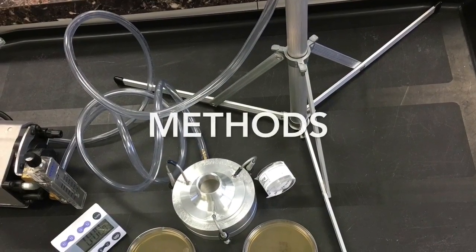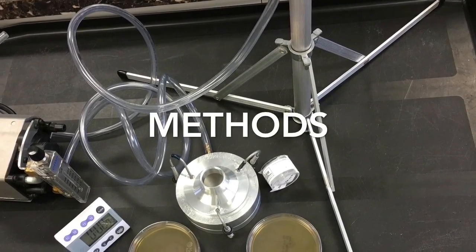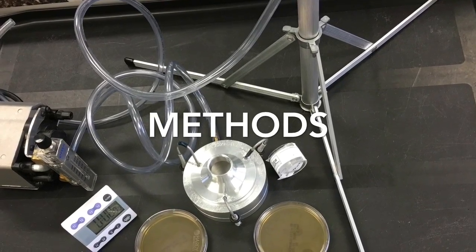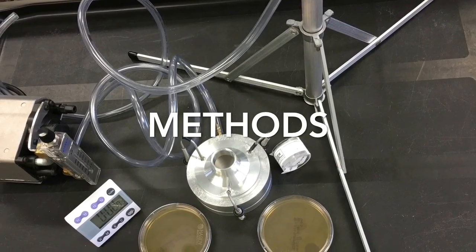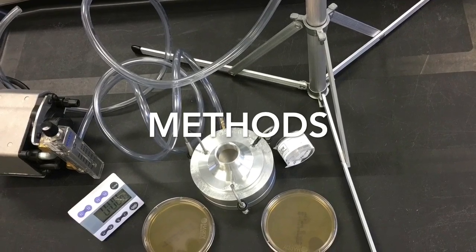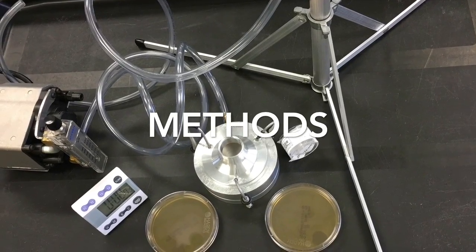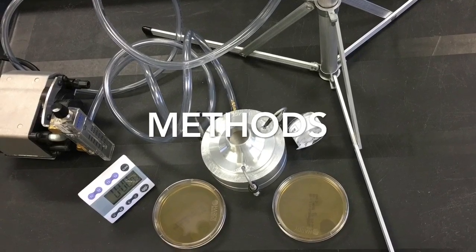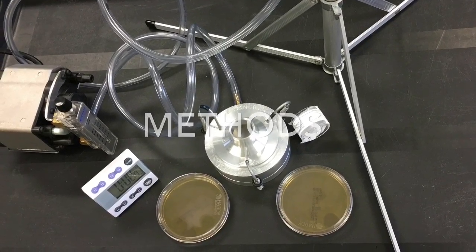The purpose of this video is just to show you how common fungal spores are in our environment, both in indoor and outdoor areas. So, I will be replicating the original Facebook experiment with the Dyson Airblade and with a common hand dryer. I will also be using my professional equipment to take indoor and outdoor samples.